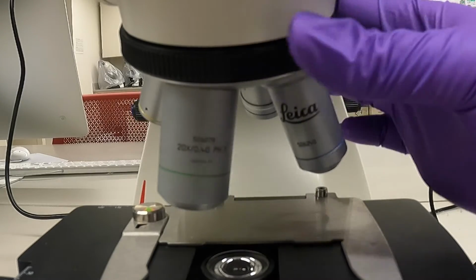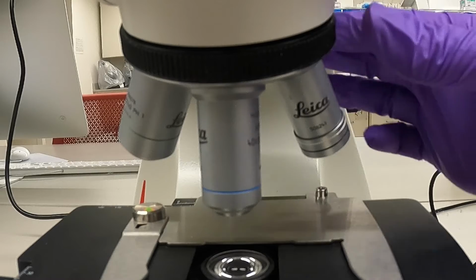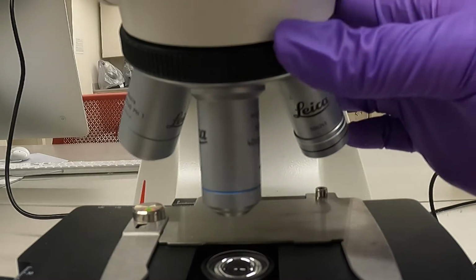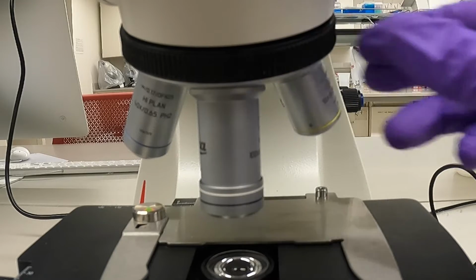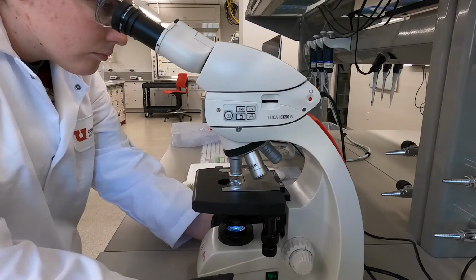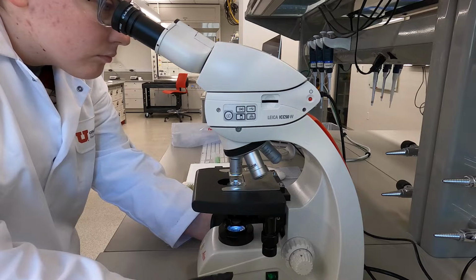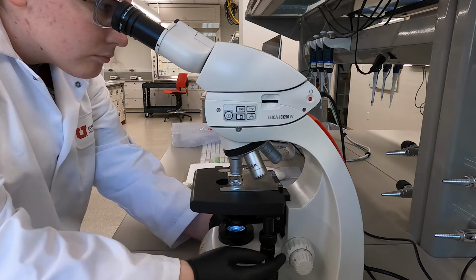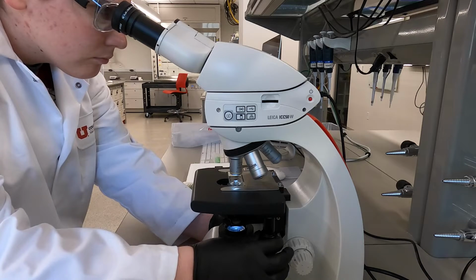Microscopes are parfocal, meaning that if the sample is in focus for one objective, then it should be in focus for the other objectives as well. However, after you have changed the objective, if the image is not clear, you might still need to refocus. When you are focusing at this point, you should only use the fine focus knob. If after focusing you find your slide is no longer centered, you can use the stage controls to recenter the sample.